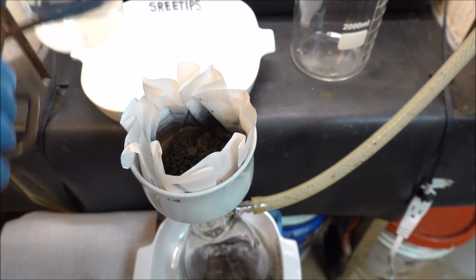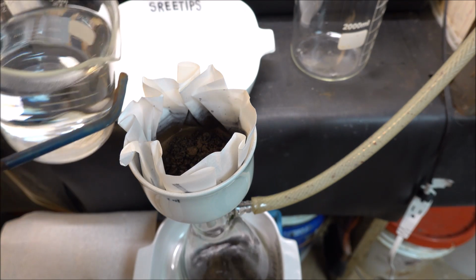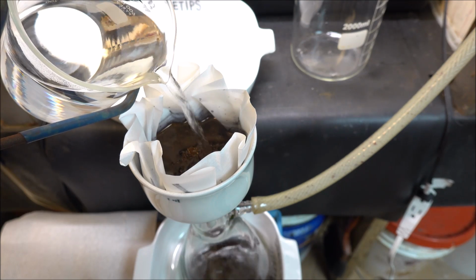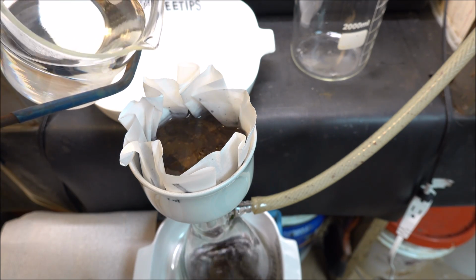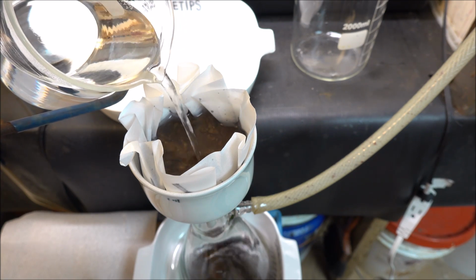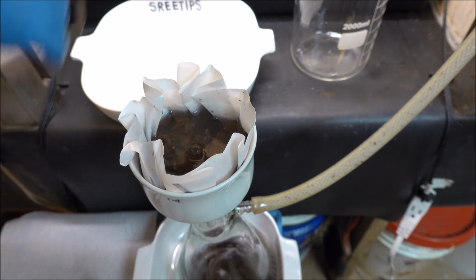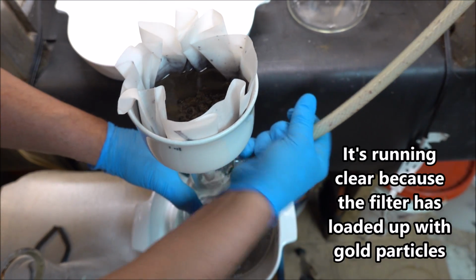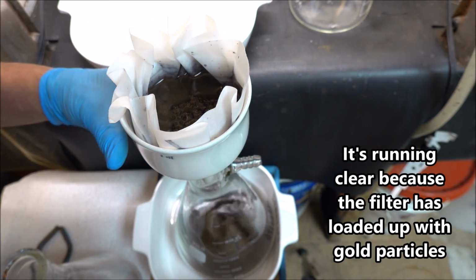We're going to pour it through here and try to rinse this gold off with some hot distilled water. Here we go. The goal here is to get the silver rinsed out of this so that we can add aqua regia to it and not have a bunch of silver chloride forming in there. Okay, the solution looks like it's starting to run clear now. So I'm going to swap out the flask here.